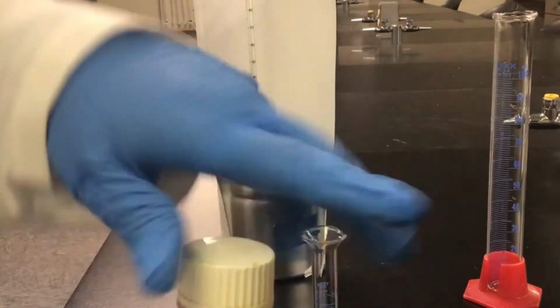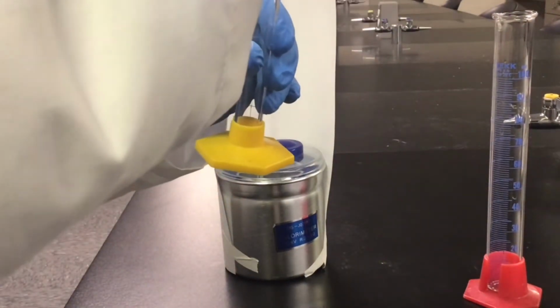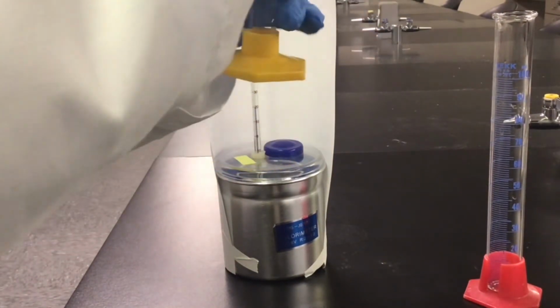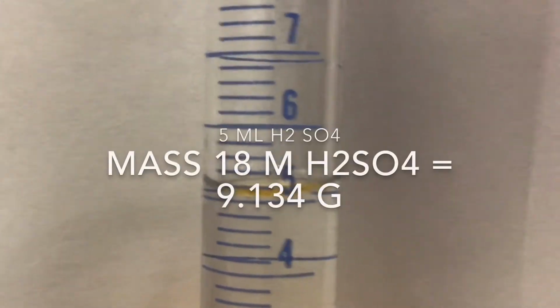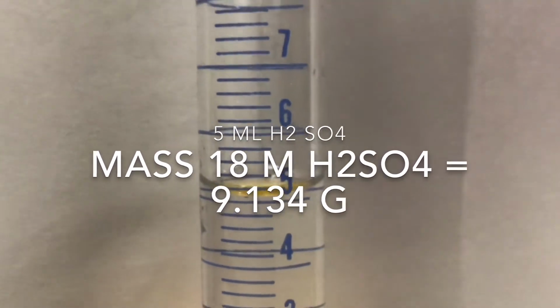Next, we'll measure out 5 milliliters of the sulfuric acid, and we will record the mass of the sulfuric acid.